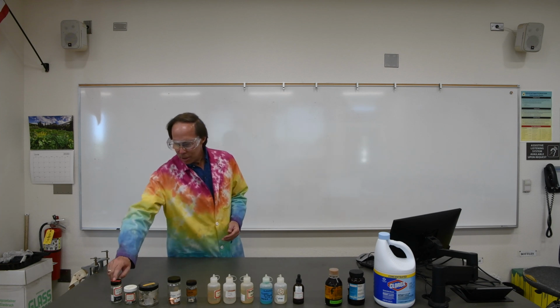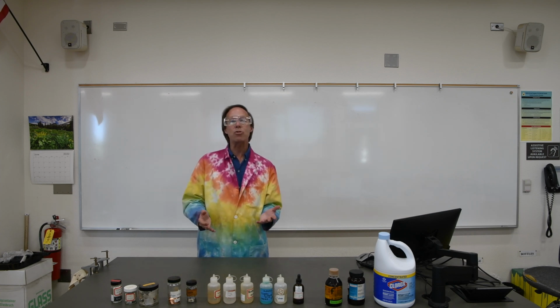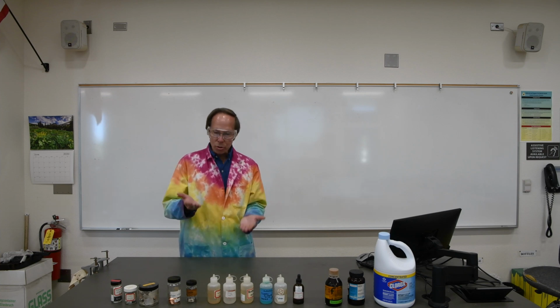We have magnesium, zinc, silver, copper, and iron. And we have solutions of compounds of each of those metals, and we'll be carrying out a series of reactions, and in each case we'll be determining which of those metals is more reactive. So in each reaction there'll be a winner and a loser essentially, and we're going to rank the metals like one would rank sports teams.